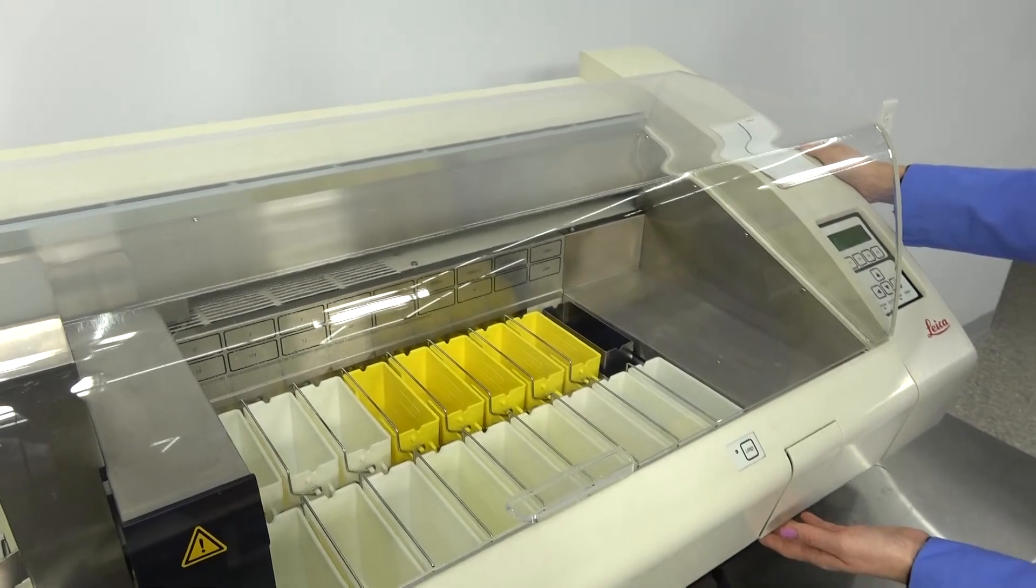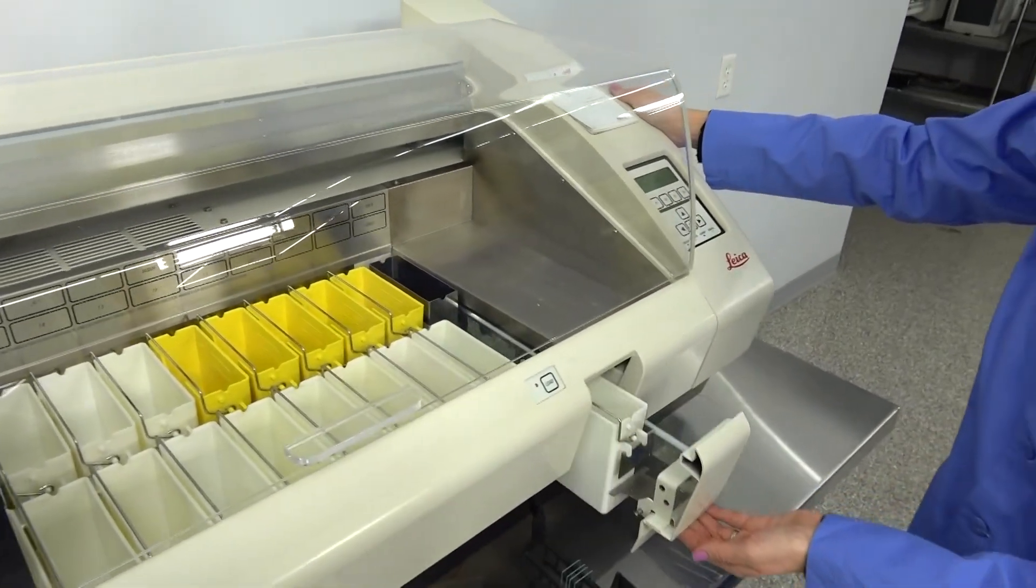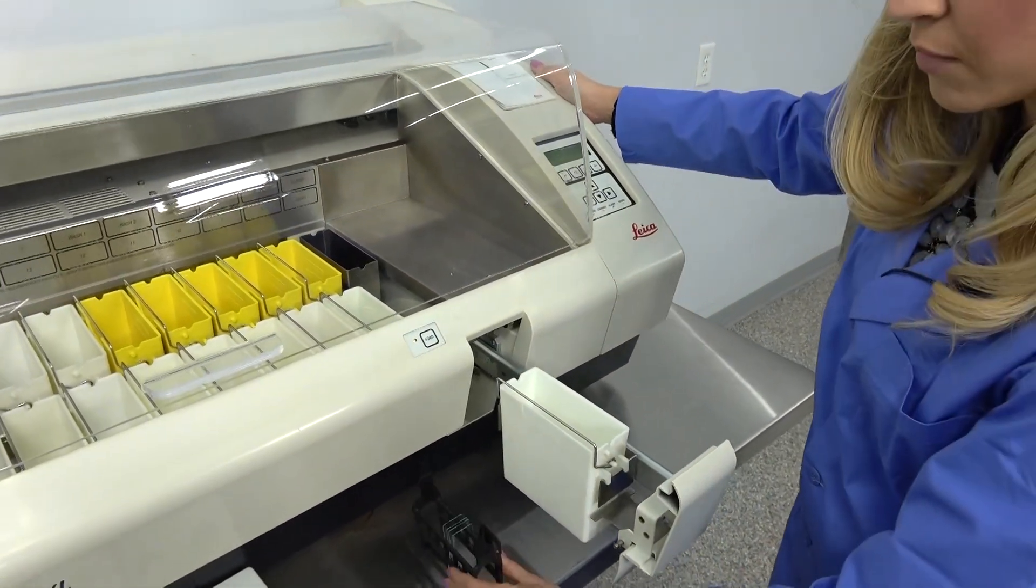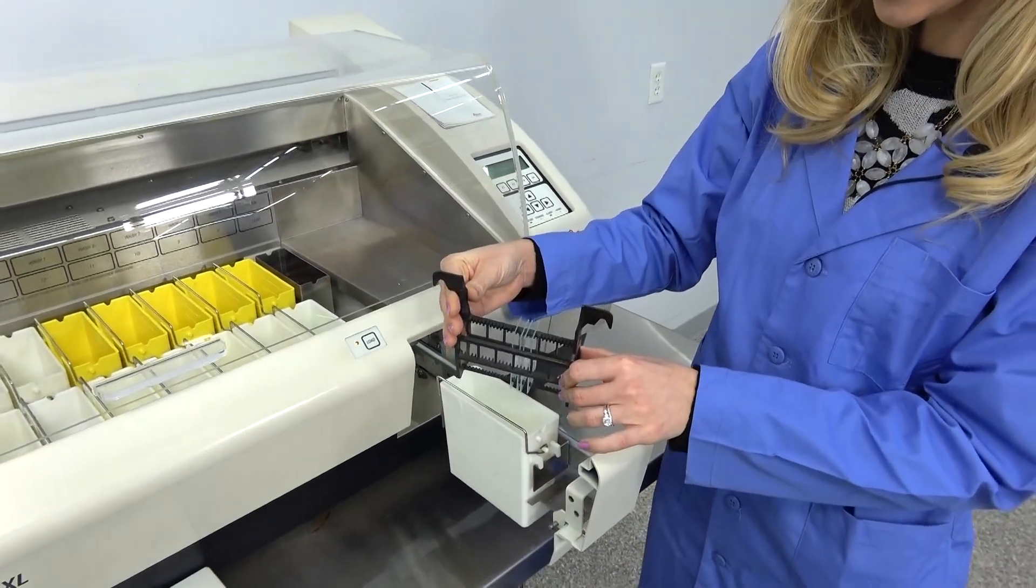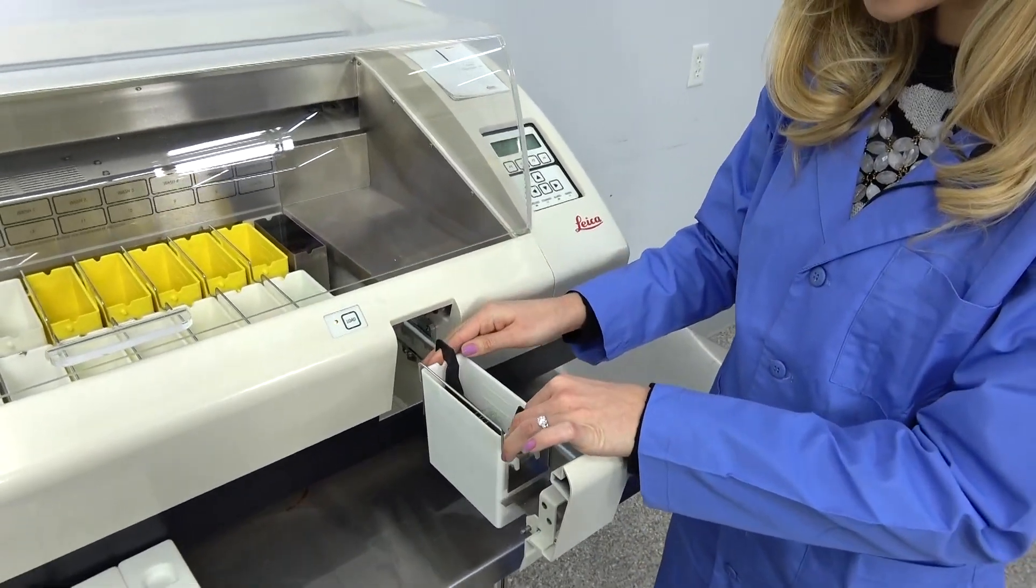To prime this, we're going to open the drawer here and put in your basket with your slides, and that gets dropped in like so.